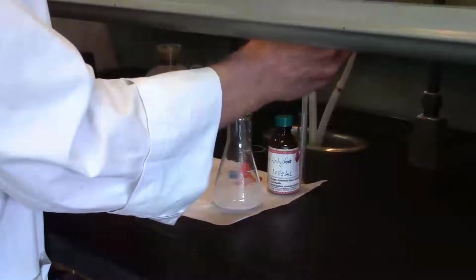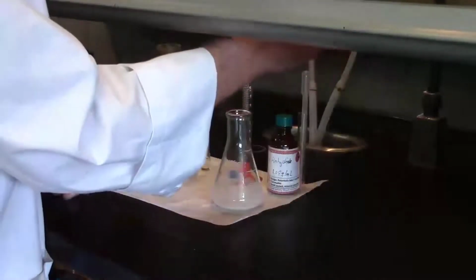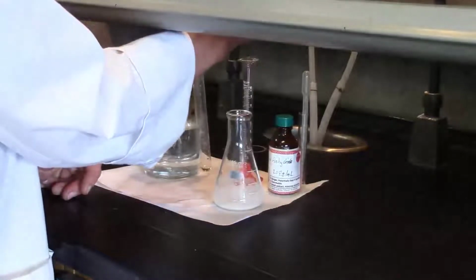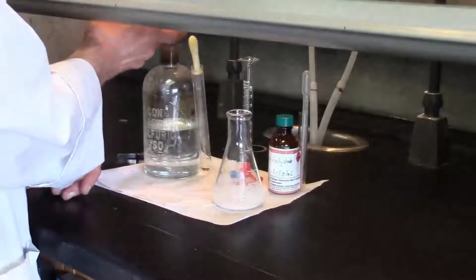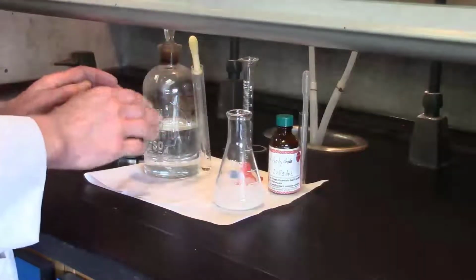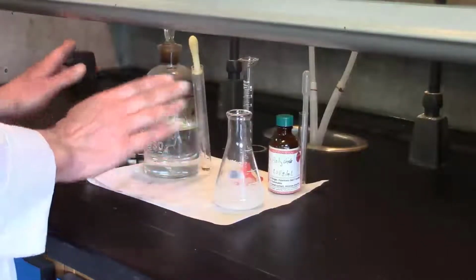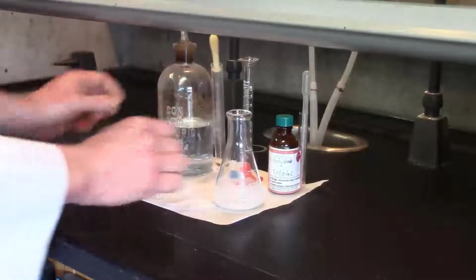So I'm going to count here. 1, 2, ... 5 drops. I will pour the rest back into the original container and of course close the lid. Please do not leave the sulfuric acid lid anywhere around here. It's very corrosive. It will corrode the paper here. You don't want anyone touching it. Okay, so please use that sort of technique.